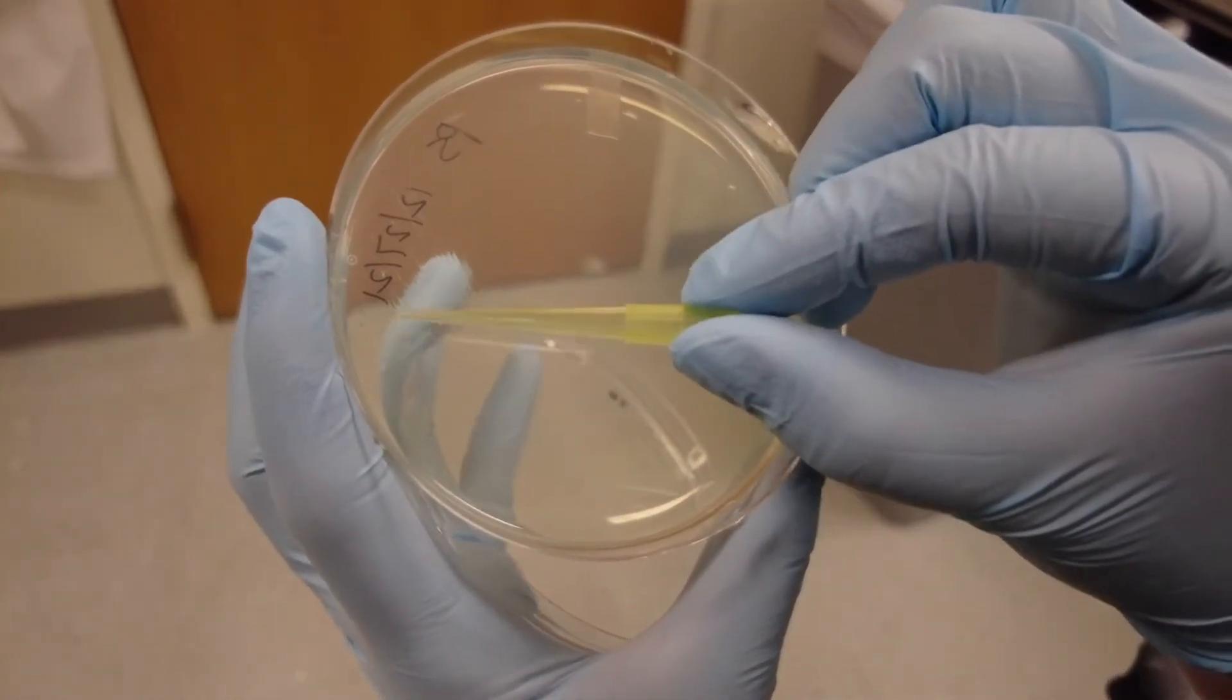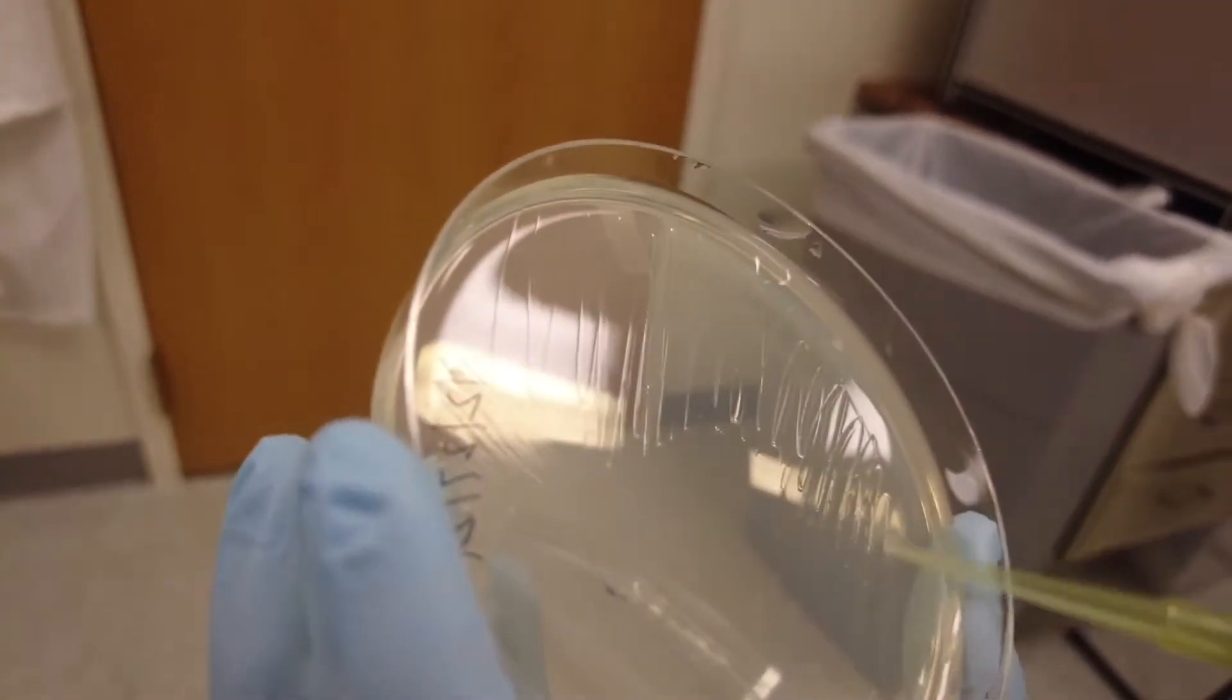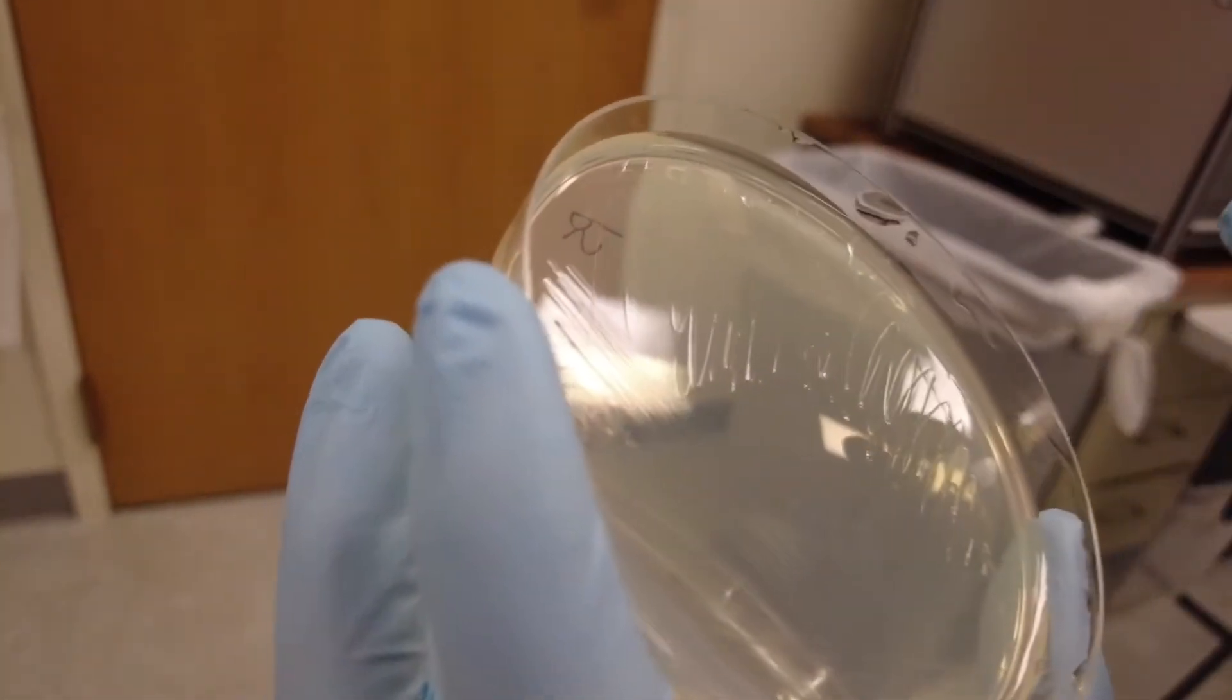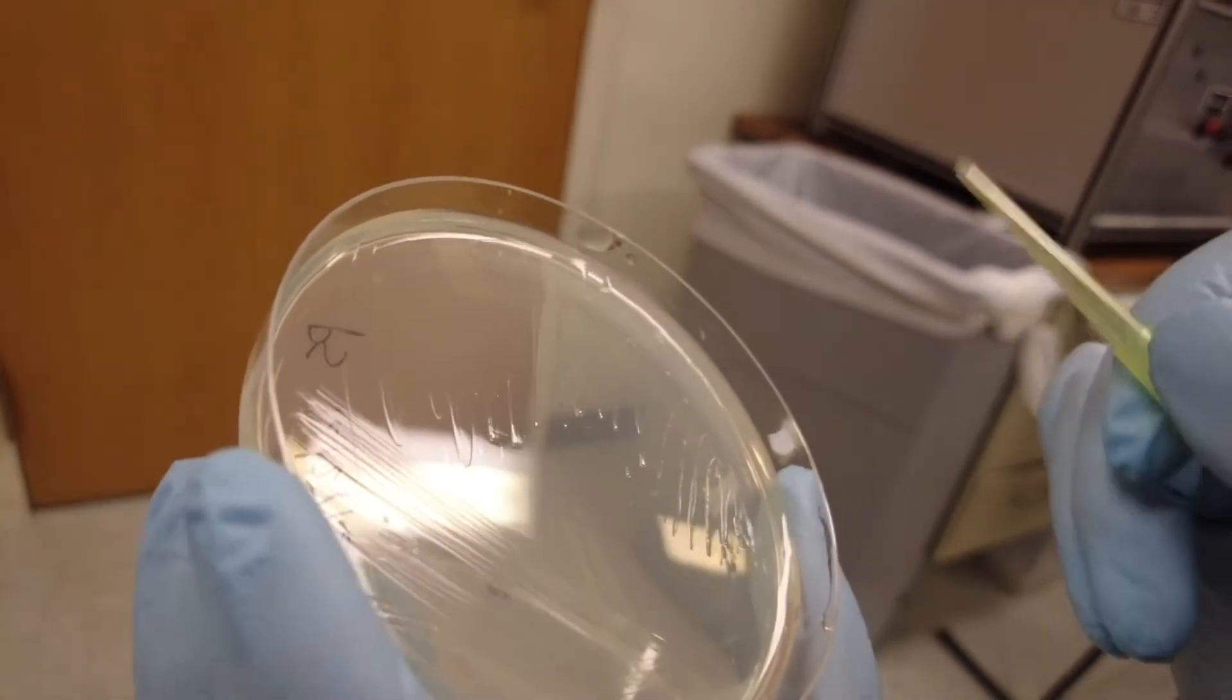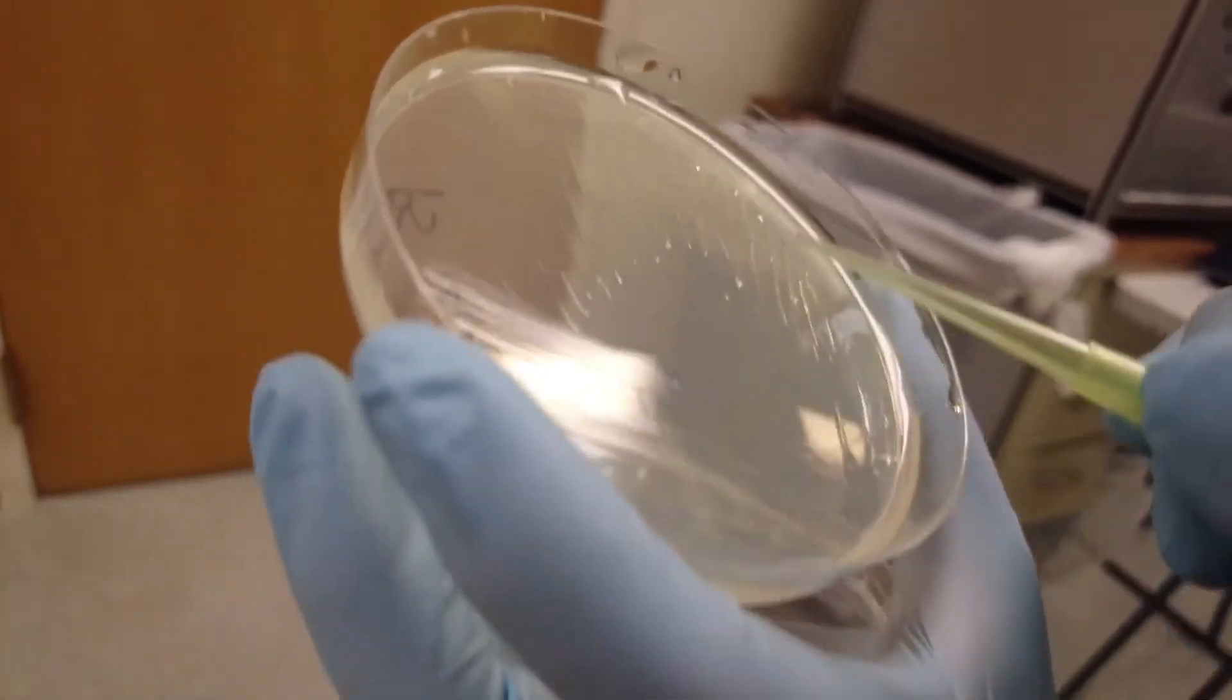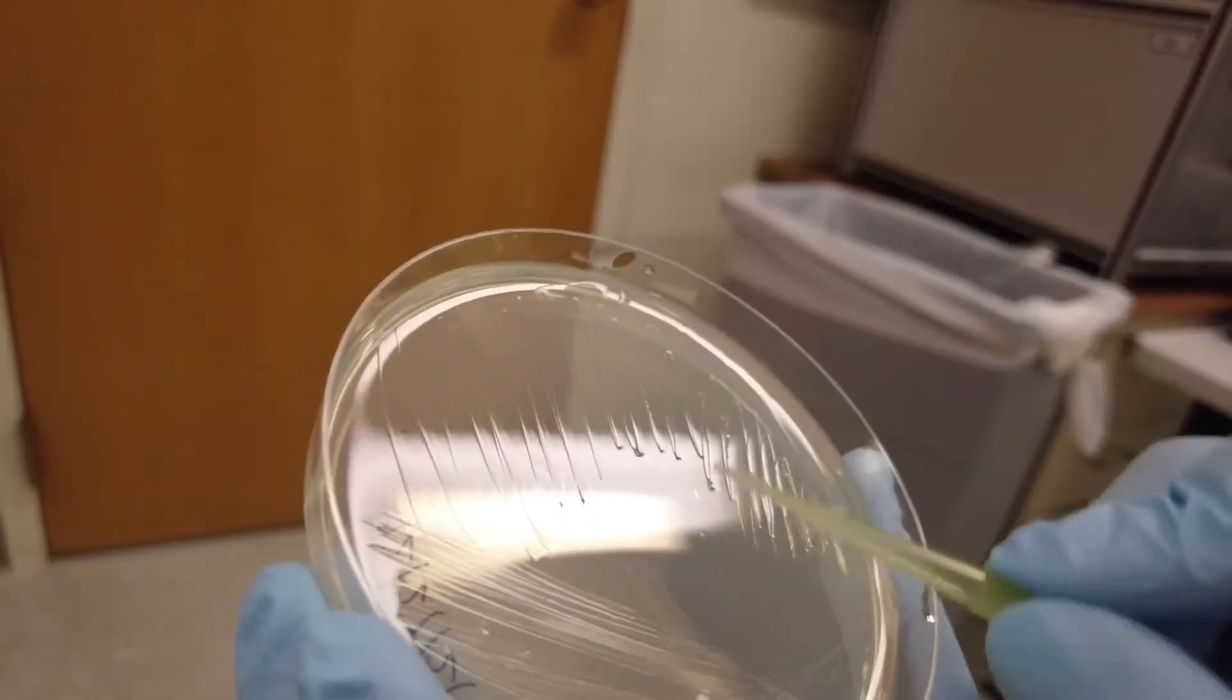You don't want to ever go back into the more concentrated place ever again, because you're diluting it effectively. You go from here, you just streak it out, then you go zigzag to all those untouched parts on a plate. Basically, the further you go, it should be very diluted. If you feel the need to dilute it again, you can take another tip, do it here on the already diluted part, take another tip, and then go this way.